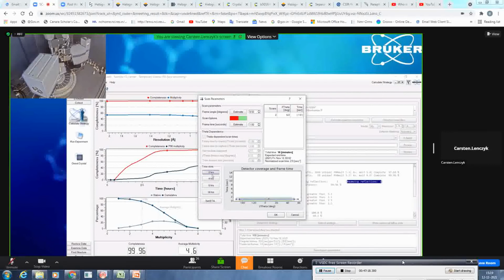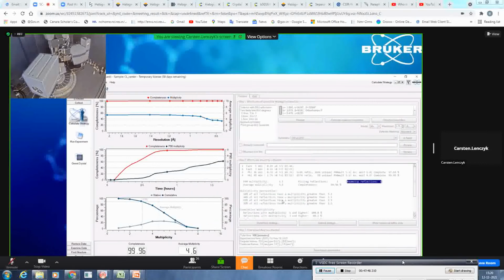Of course, you can also define, okay, please calculate a strategy which would be done in 2 hours. Then it will do 12 seconds. And you see it roughly done in 2 hours. You can also set a time when it should finish. So for example, okay, until tomorrow morning at 7, I have a time slot. So please use the time to collect this data. So I guess 1 second was already okay.